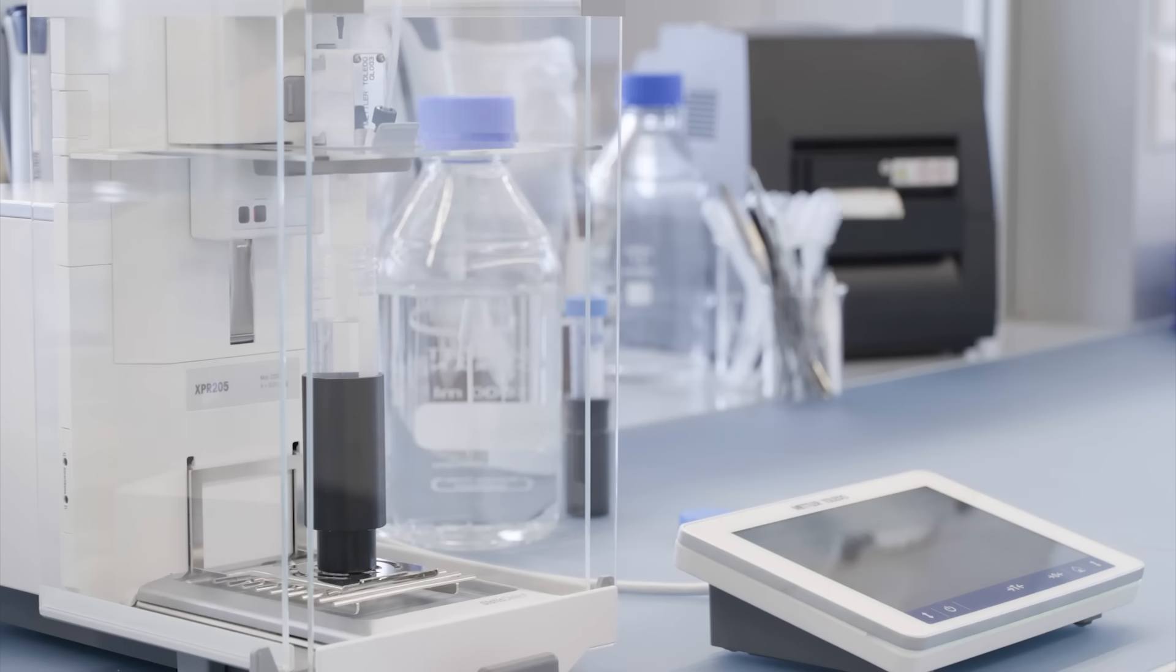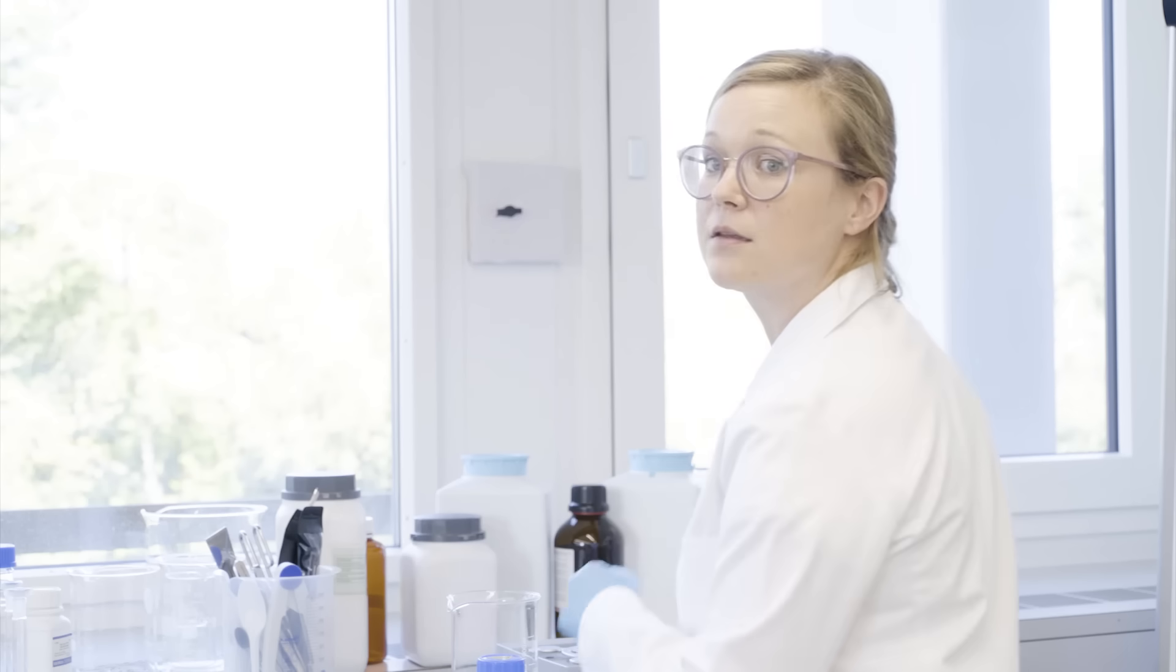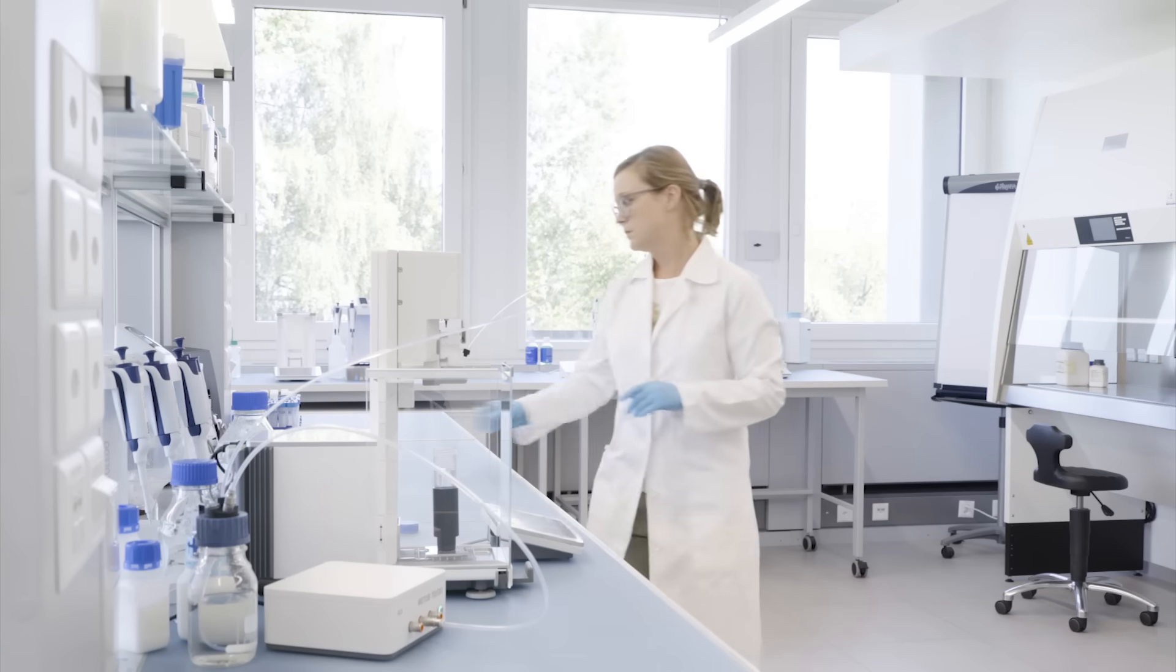And when the dispensing is finished, simply press the icon to print a label with your result and other relevant information.